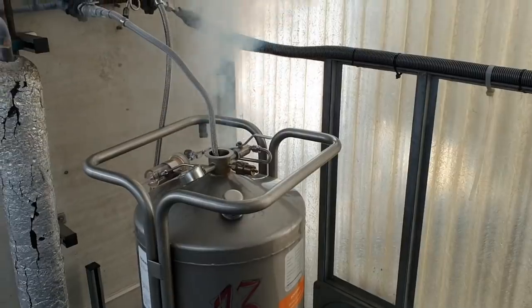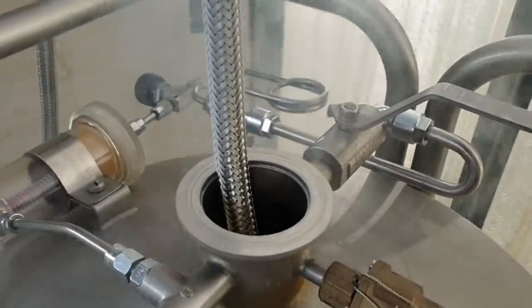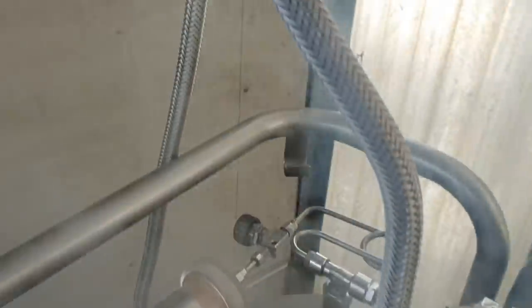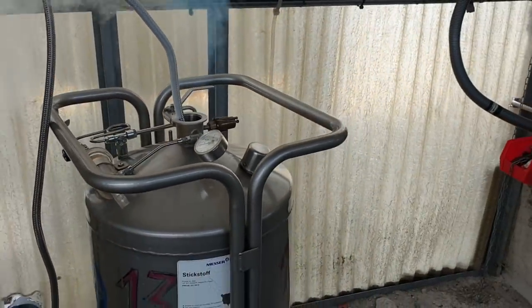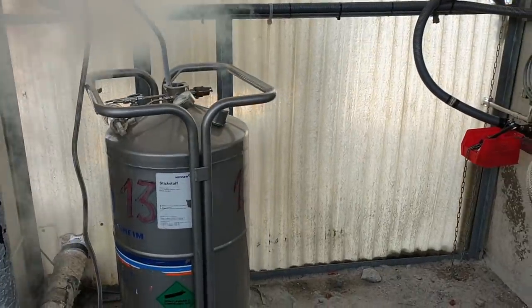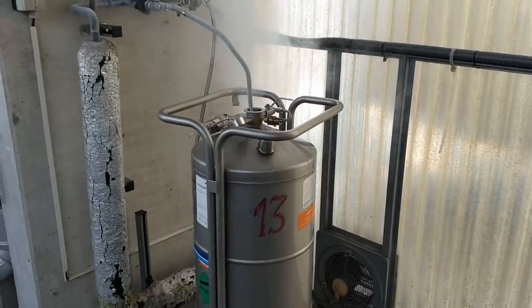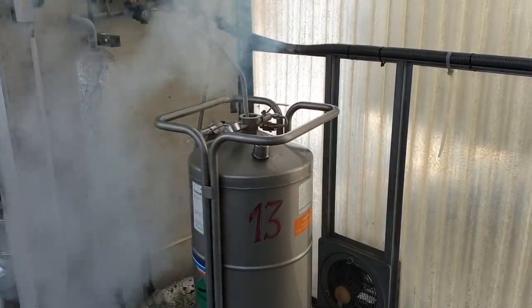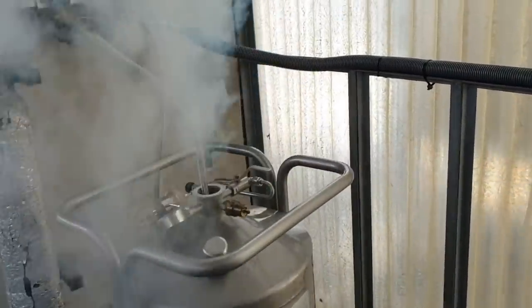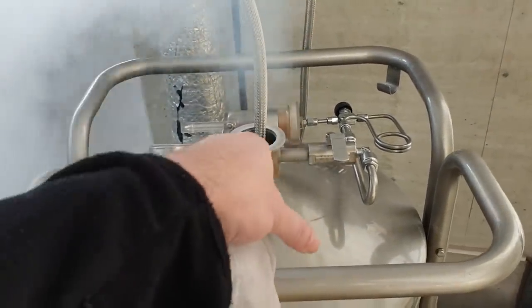You can hear it's starting to kick in now and it's all getting really cold. We'll just cool all this down. That thing takes — I forget exactly — 100 to 200 litres or something, which is about your own body weight in liquid nitrogen. It'll take 10 minutes or something to fill up. And then when it does get all full, this will all be frozen like a block. When that happens I'll let it defrost for a bit and show you how you put it all back together again.